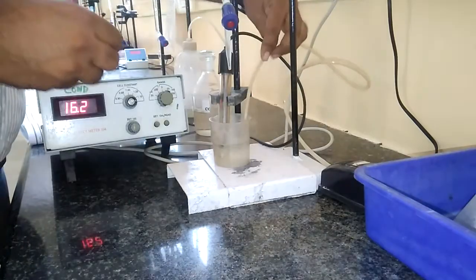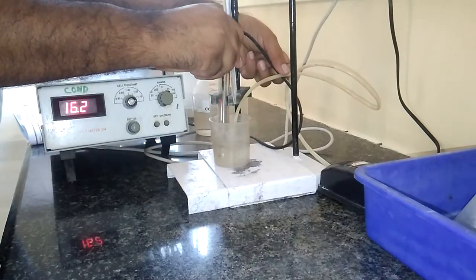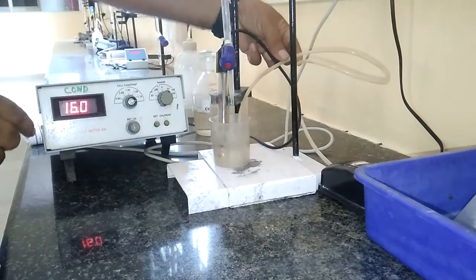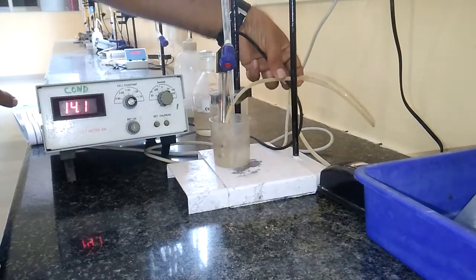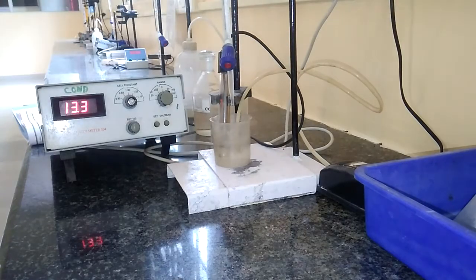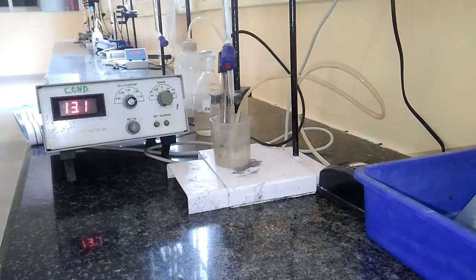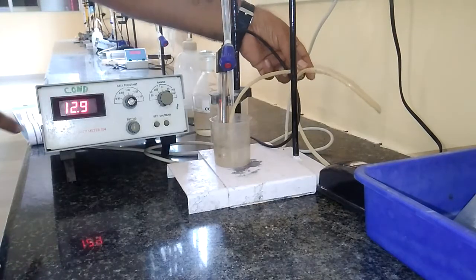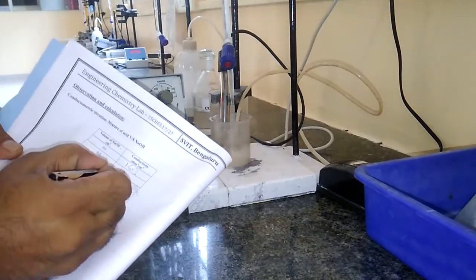Let us start the titration by the addition of 0.5 ml of NaOH. Now I am adding 0.5 ml of sodium hydroxide. The reaction mixture has to mix well. After that, let us record this value. There will be a gradual decrease in the conductance values. This decrease is due to the replacement of highly mobile hydrogen ions of hydrochloric acid by less mobile sodium ions of sodium hydroxide. Due to this replacement of ions, there will be a decrease in the conductance values. The recorded value is 12.8.